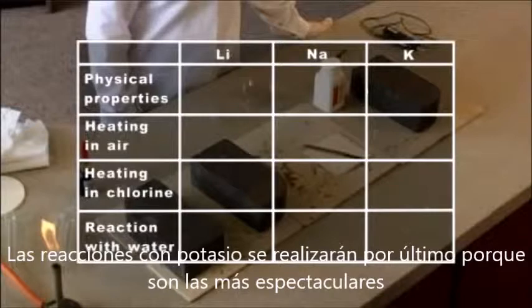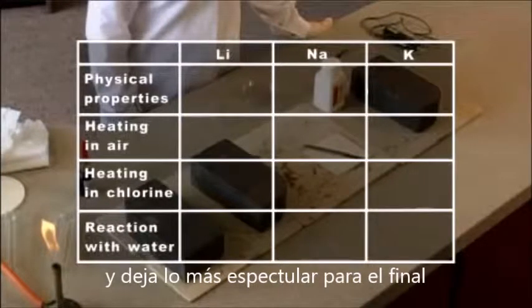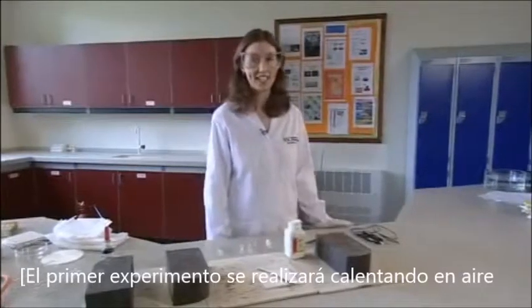For greatest impact, do the reactions of potassium last, as they are the most spectacular. Periodic table order seems logical and builds to the most spectacular at the end. The first experiment is going to be heating in air.